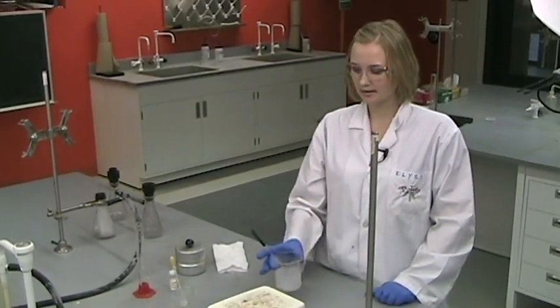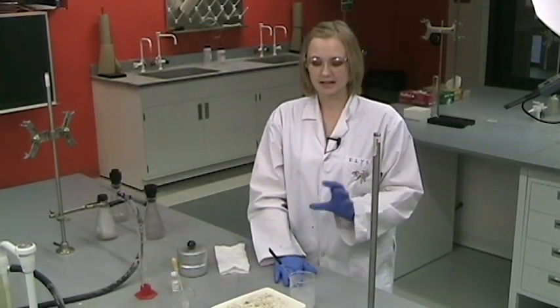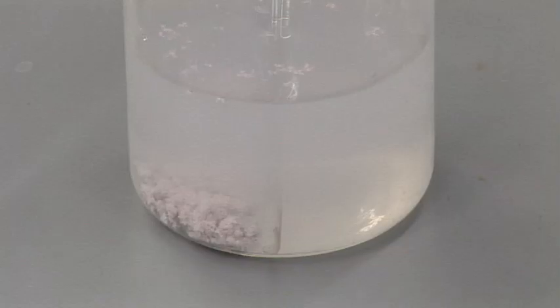Remove it from the hot plate and put it in your drawer to cool off so that it's not exposed to light. It takes on a bit of a purple colour when it is decomposing in light.